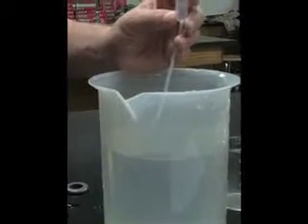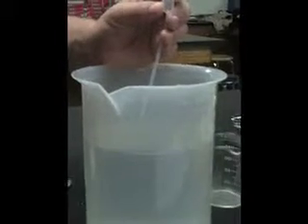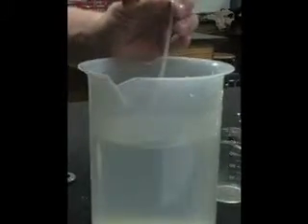This lab demonstrates Charles' Law. Before doing this lab, make sure you have your lab goggles on. Obtain a pipette and fill it completely with H2O, aka water. Find the volume of the pipette by counting drops and record it.